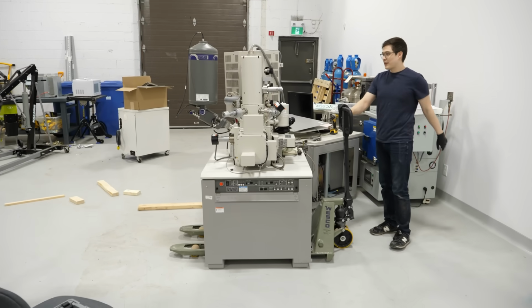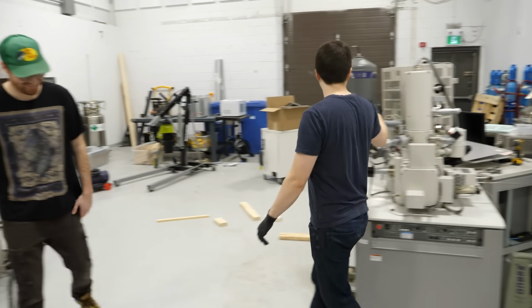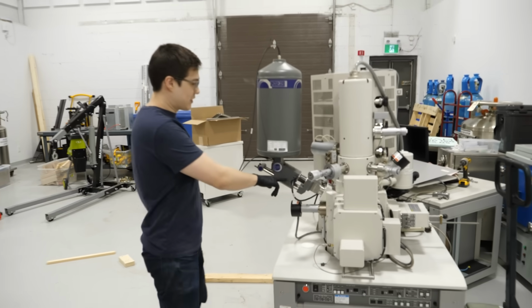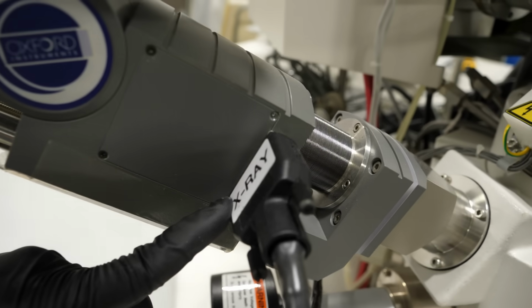Well, the bigger challenge is figuring out how any of this works. I can't help you there. This is cool though. X-ray. Look, it even says X-ray on it. Interesting. Yeah.